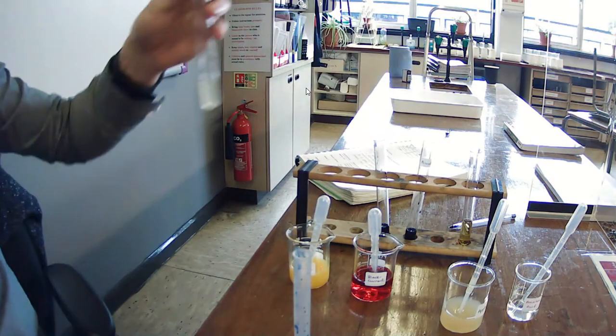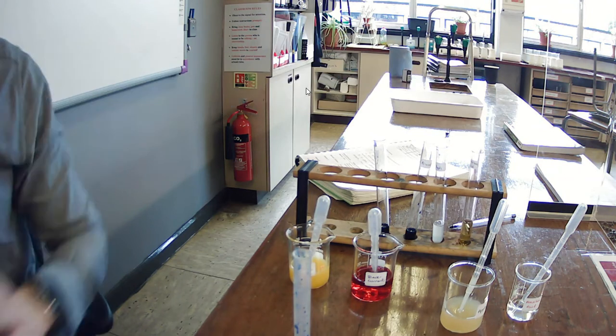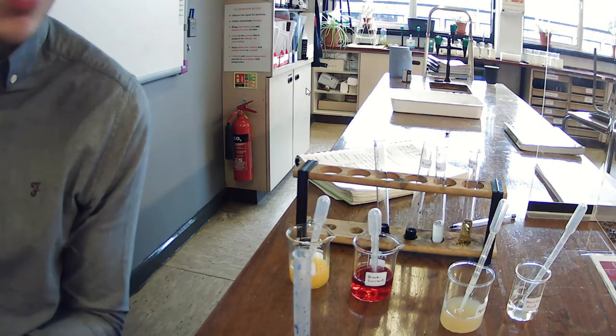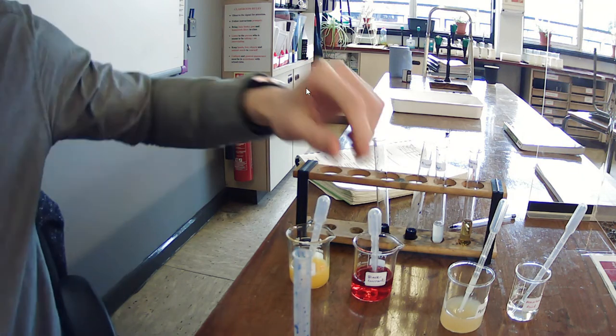So it's not clear this time, but it has returned to its original color. So they're very similar in color, slightly better. Maybe this took 40 drops. Okay, so from that we can see that ascorbic acid, which is pure vitamin C, obviously has more vitamin C in it than apple juice.